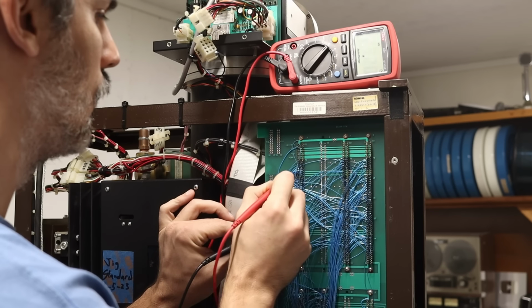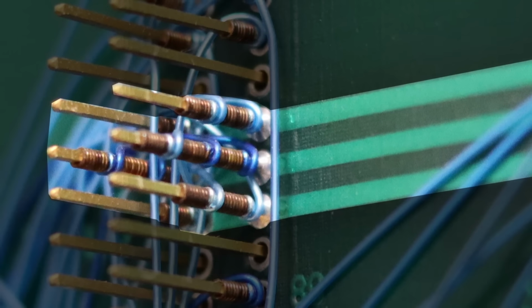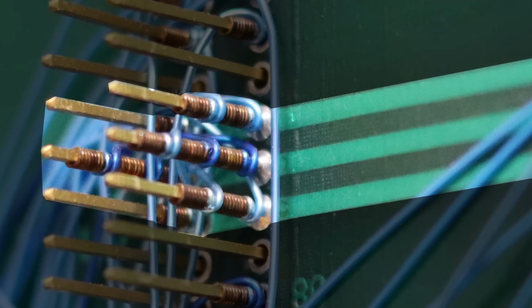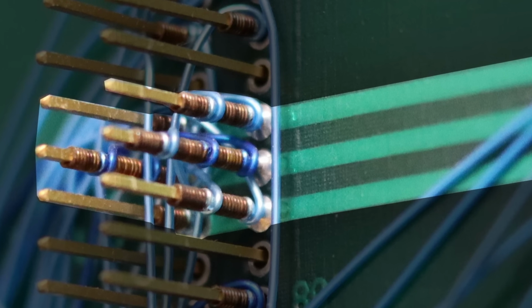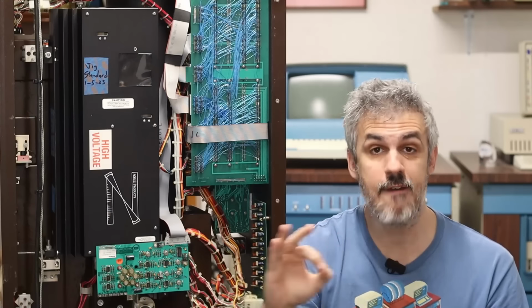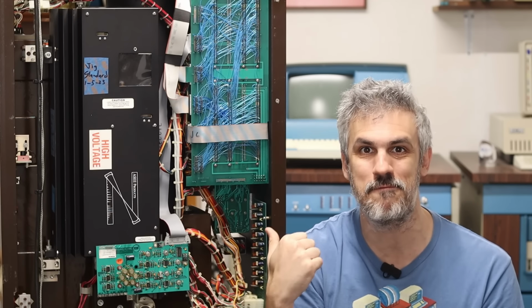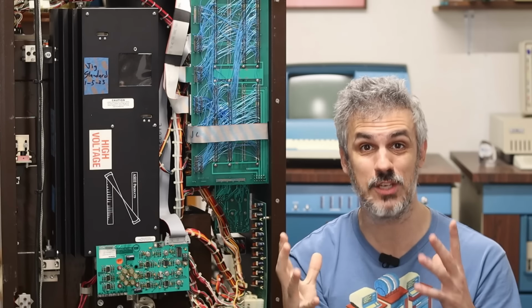And then I started looking a little closer. If you look at the right side of this card edge connector, you can see that the 3 pins on those traces are very affirmatively soldered in. But if you look on the left side, where our wire wrap wires are connected, the pins are not soldered to the through holes. As near as I can tell, this backplane never should have worked, but this machine came out of a working environment. So what the heck is going on here?